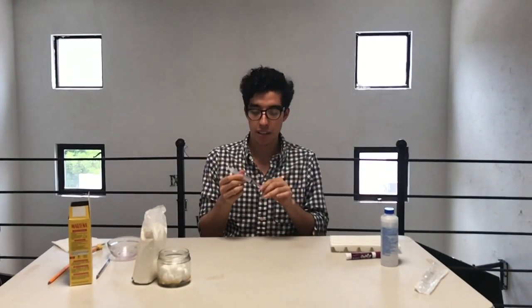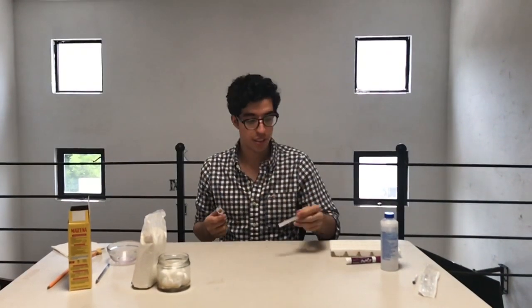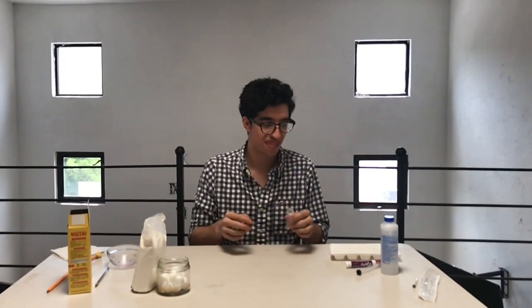Okay, we will start with the experiment. First of all, we need to remove the needle and the plug of the syringe, or our column. I will refer to it as our column because it's what it is.